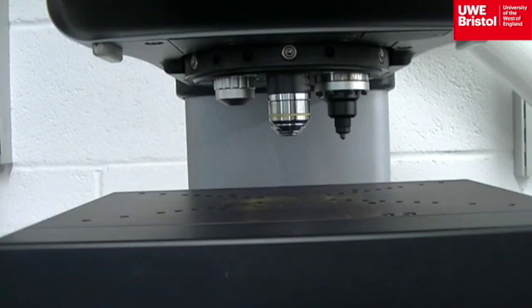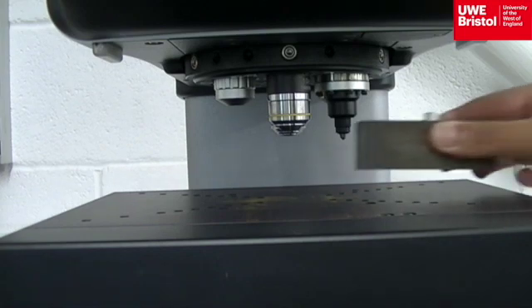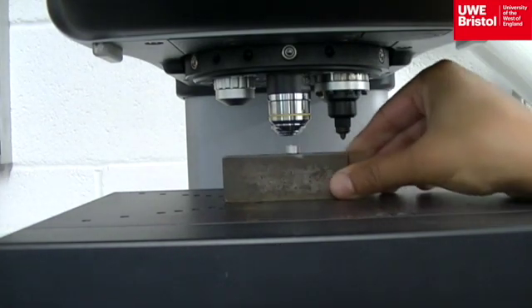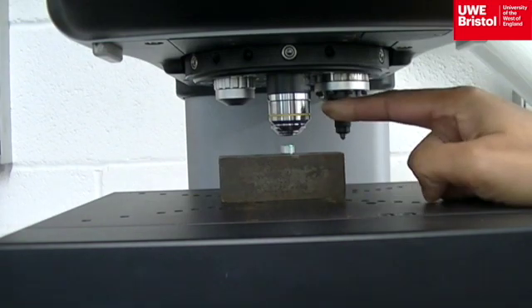The specimen is placed under the magnification lens, where a green pointer light will shine on the surface, indicating the location where the indenter will make its mark. Avoid the edges of the specimens where curvature is likely.